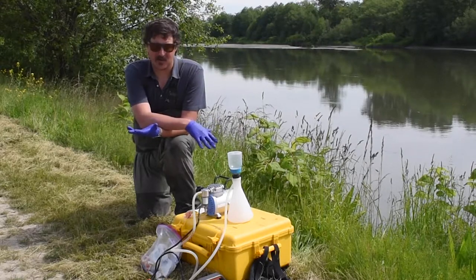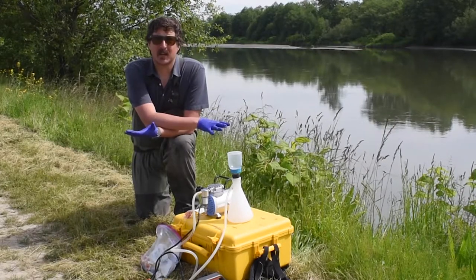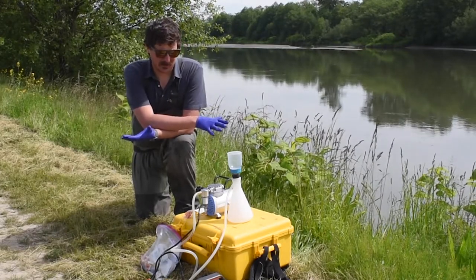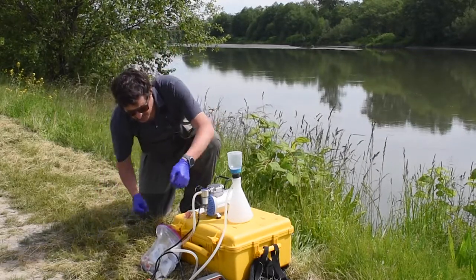With the technology and how it's evolved now, contamination is not as big of an issue as when this started. When this all started, we were hand pumping, which can be pretty time consuming. So we developed this little setup here that does the pumping for you.